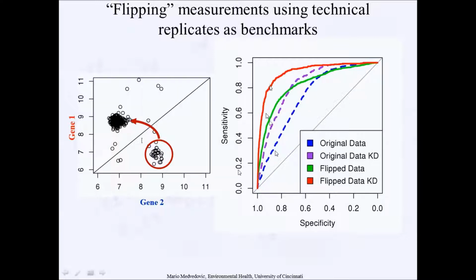So this is the point of this ROC curve, right? If we just do the original data, we get a certain level of behavior. There is a little bit more information here, but the point is that this flipped data is always better than having the original data where this is not taken care of. All right, so the reason why I'm talking about this is that, going back to the behavior of this one gene, ERBB3 could potentially be an artifact related to this deconvolution.